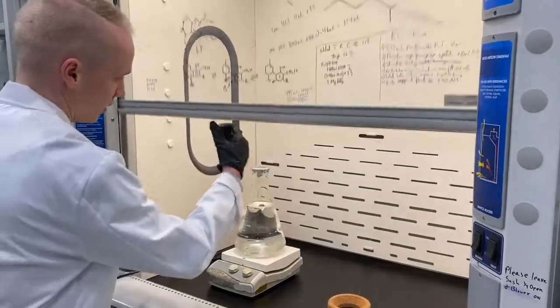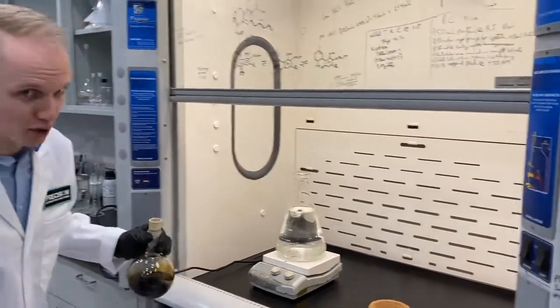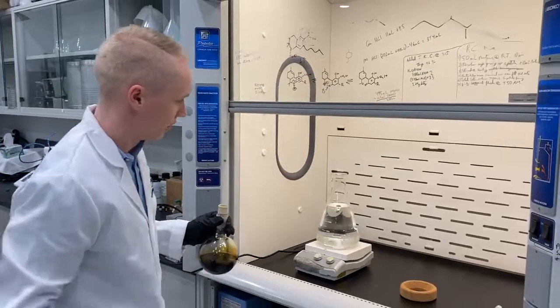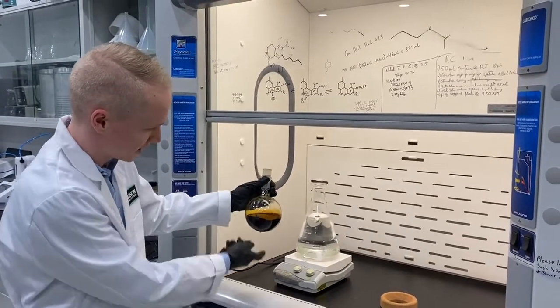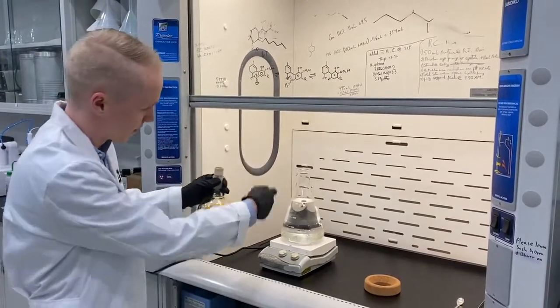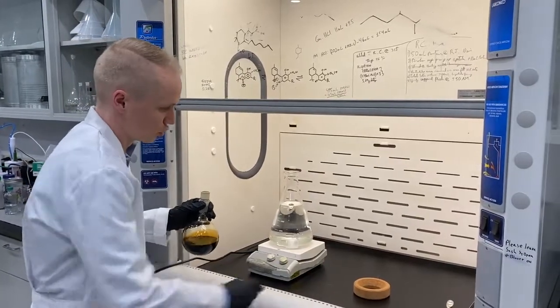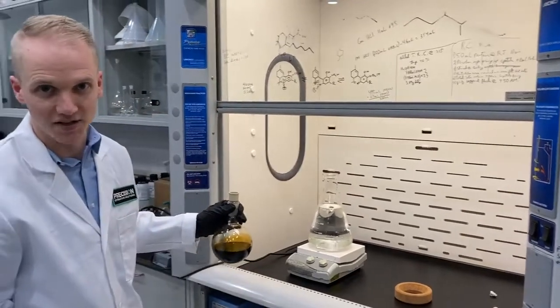So we've got our solvent that we've manipulated a little bit here under the fume hood, and what I'm going to do is take the crude and dump it right into the solvent in order to show you how quickly this process works.